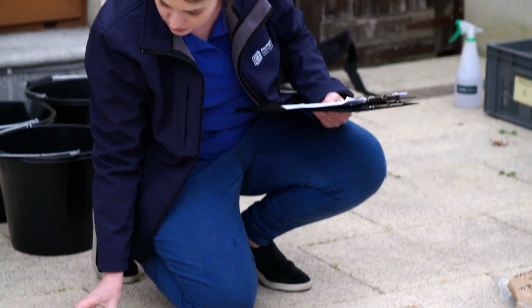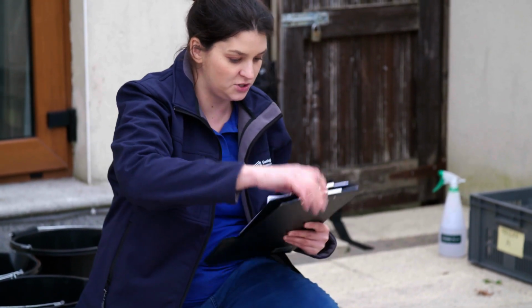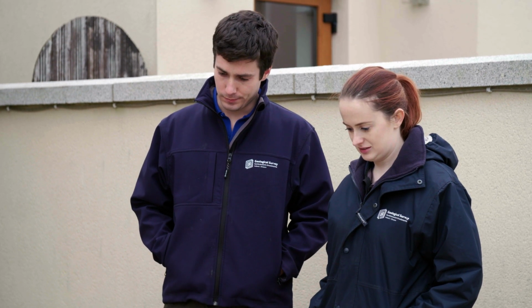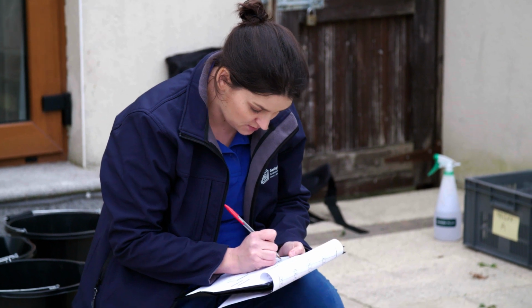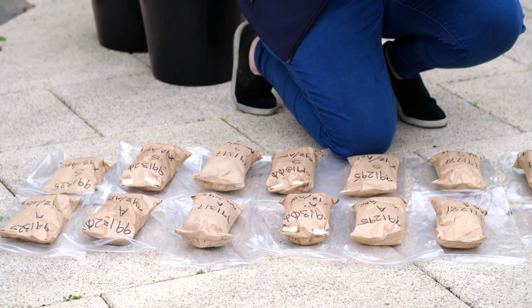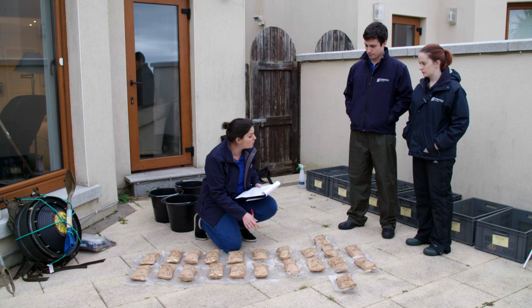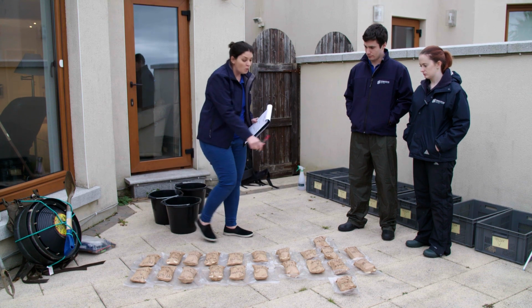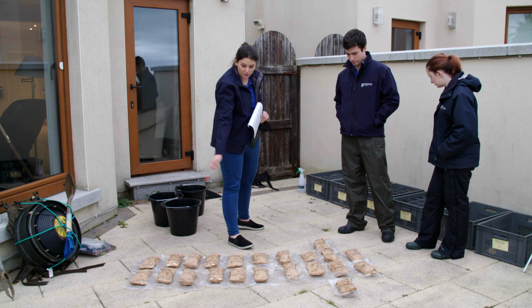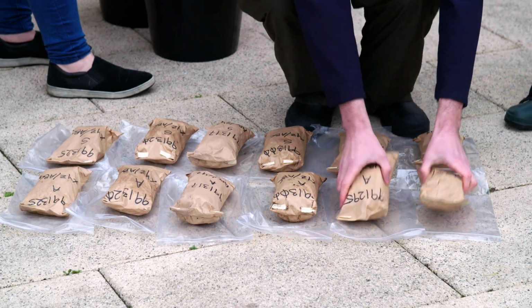If a sample was collected but is missing, a thorough check of the field rucksack and vehicle should be undertaken straight away. If any problems or issues arose during a field visit that resulted in samples not being collected, these should be discussed with the sampling team. Any issues regarding numbering errors, breached or leaking samples, or missing samples must be addressed. Decisive action should be taken regarding the rejection of any samples. Real-time feedback should be given to the sampling team, delivered in a constructive manner.